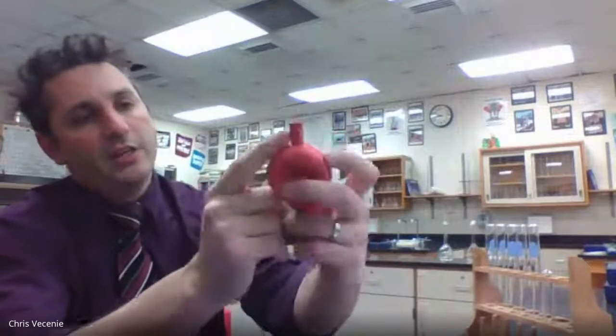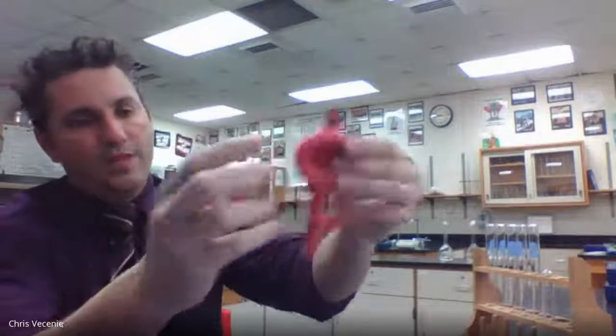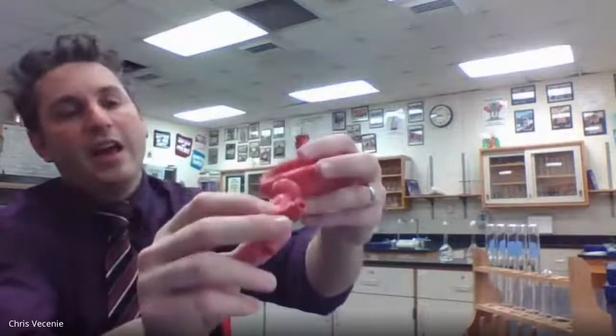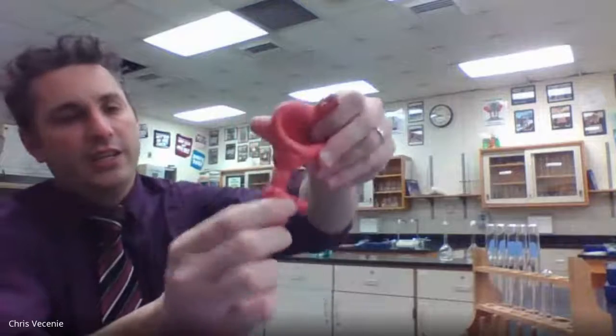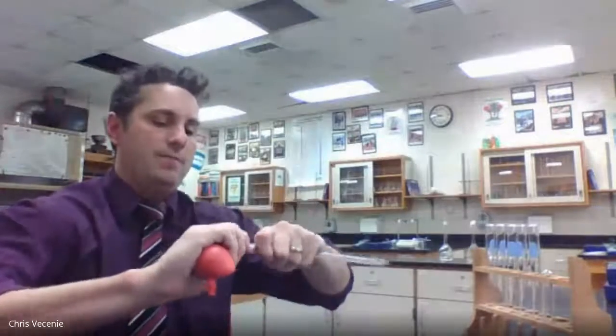So the first thing we have to do is prep these dilutions. To do that, we took this volumetric pipette and the pipette bulb. How the pipette bulb works is there's a letter at the top that says A. You squeeze on that to deflate the bulb, which creates a vacuum in here. Then there's an S button and an E. S lets you draw solution up, and E lets you release solution. So we attach that to the top.